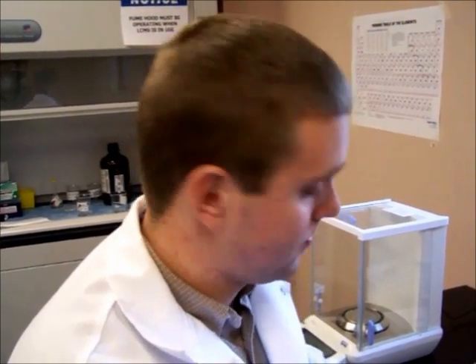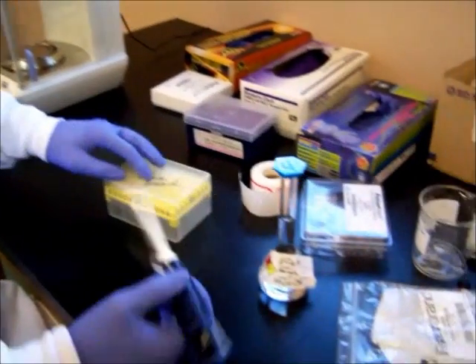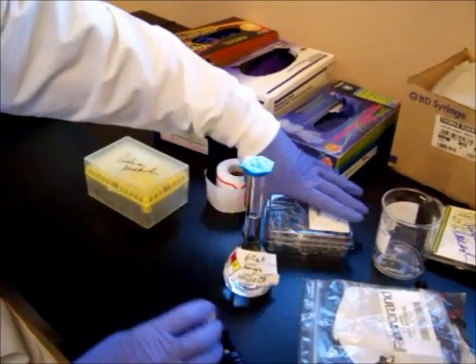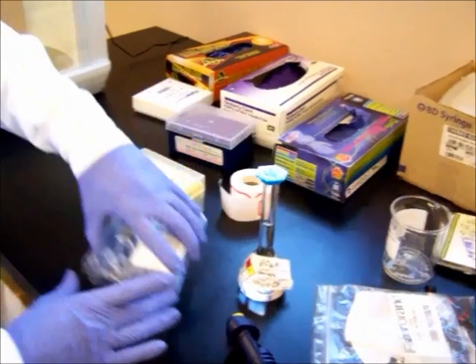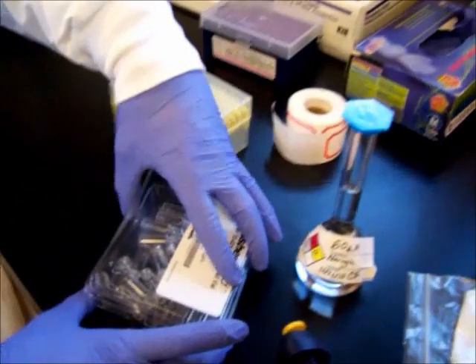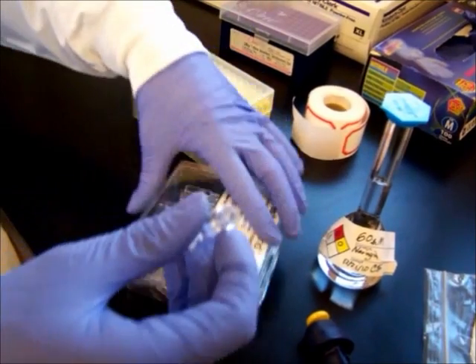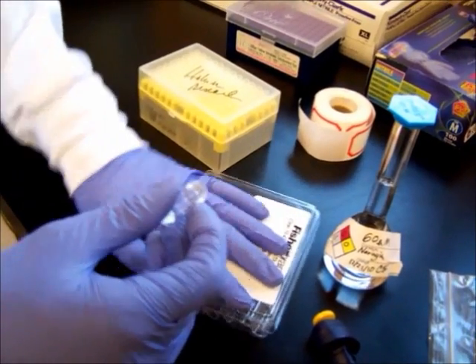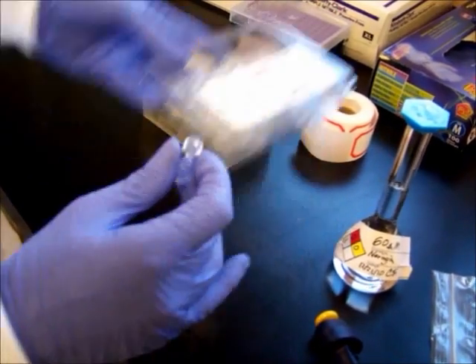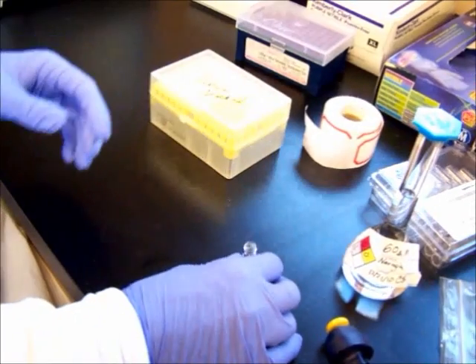What we're going to do now is we're going to prepare the sample for it to be loaded into the instrument. These are the glass vials we use. Each one can hold approximately 1 to 1.2 milliliters of material, and it's secured with a cap.